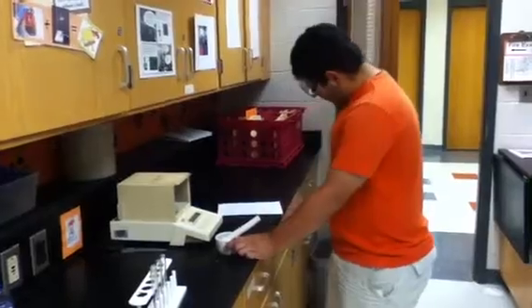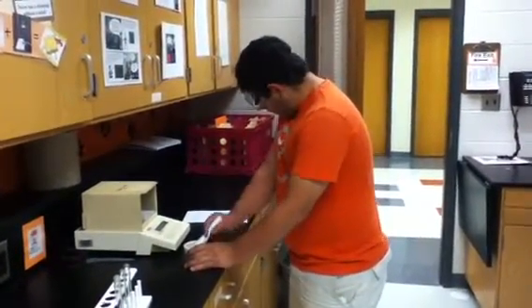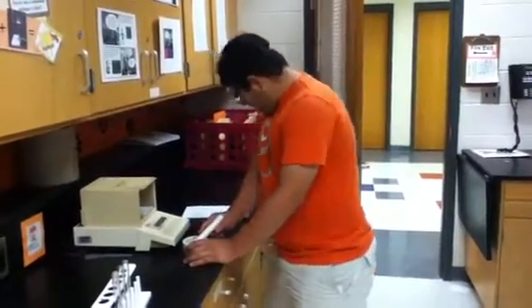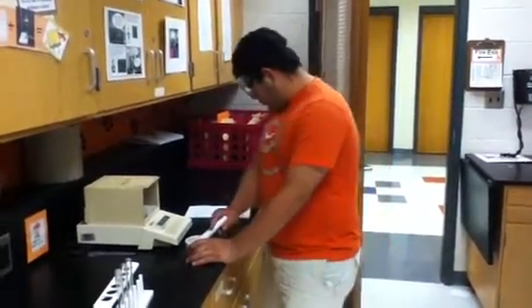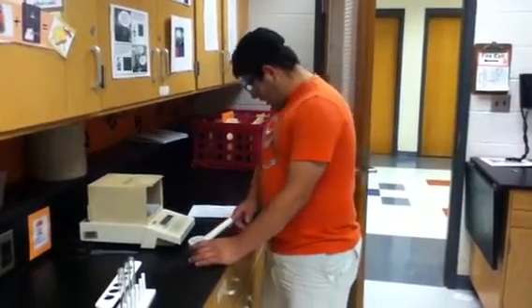You can use a mortar and pestle safely by firmly gripping the bottom of the mortar and grasping the pestle as you push down on the substances inside. Leave an adequate quantity of crystals between the pestle and the bottom of the mortar as you crush the items inside.